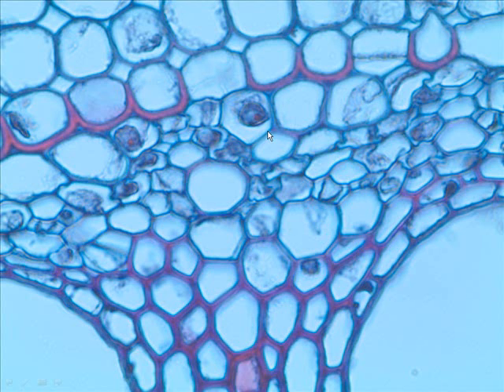Let's take a final closer look. Again, we have this layer right here with a thick coating of suberin. And so this layer is called the what? The endodermis. Just inside the endodermis is what layer of cells? The pericycle. Yes, the pericycle. And these big cells to the lower right and lower left there, what kind of cells? Xylem. And finally, what's this little patch of cells right here? That is phloem.